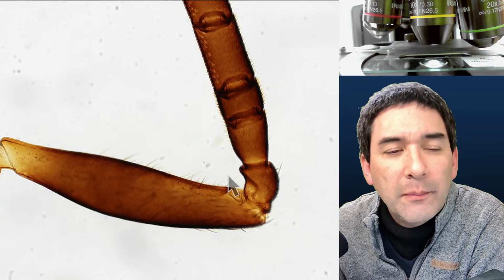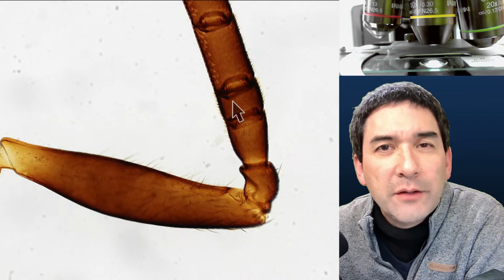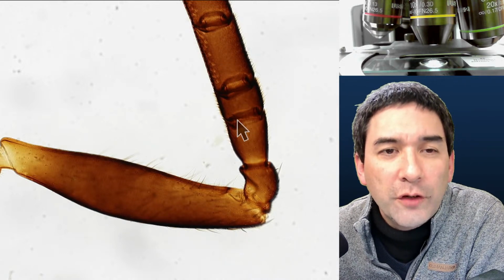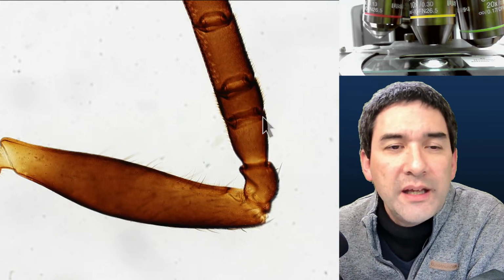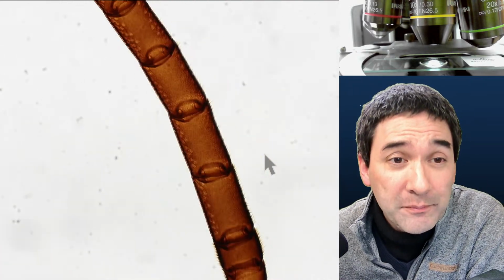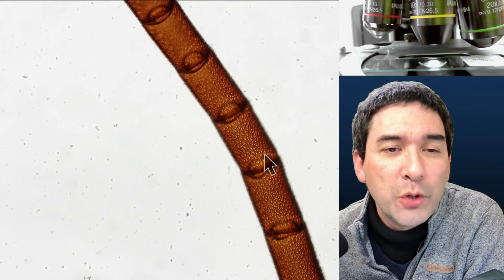Yeah. What we have over here on the outside is known as the so-called exoskeleton. It's made of a substance called chitin. And essentially all of the soft parts like muscles and blood vessels are on the inside. So that's why insects have this protective, you do not say shell, because shells per definition contain calcium carbonate.